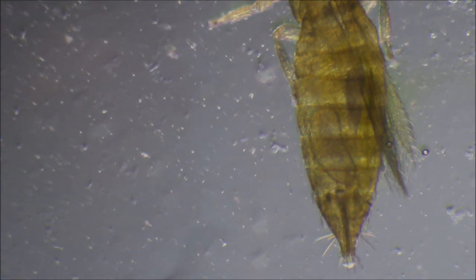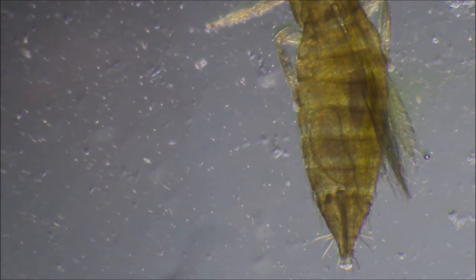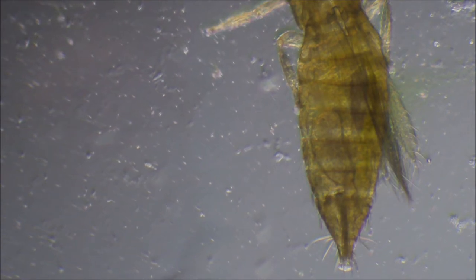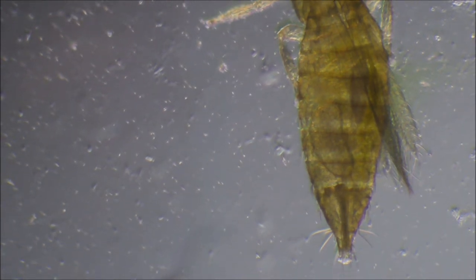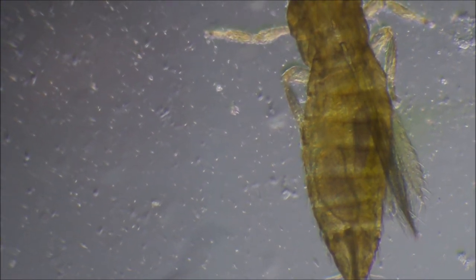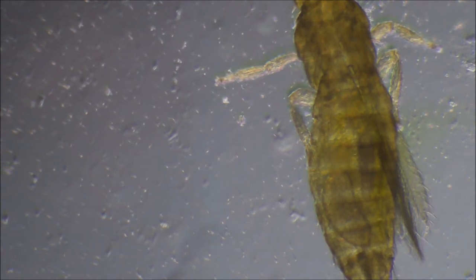I sprayed some ISO on a plant to see how it would go — it works, but you've got to be careful. If you leave it on too long, the cells will shrink, die, and trigger a hypersensitive reaction, killing off other cells too. You can leave it on for two minutes, then wash the plant down. In veg that's fine; in flower I wouldn't spray after day 20 because it dissolves terpenes and oils. The potassium salts experiment ended up taking about two minutes for the thrips to die.